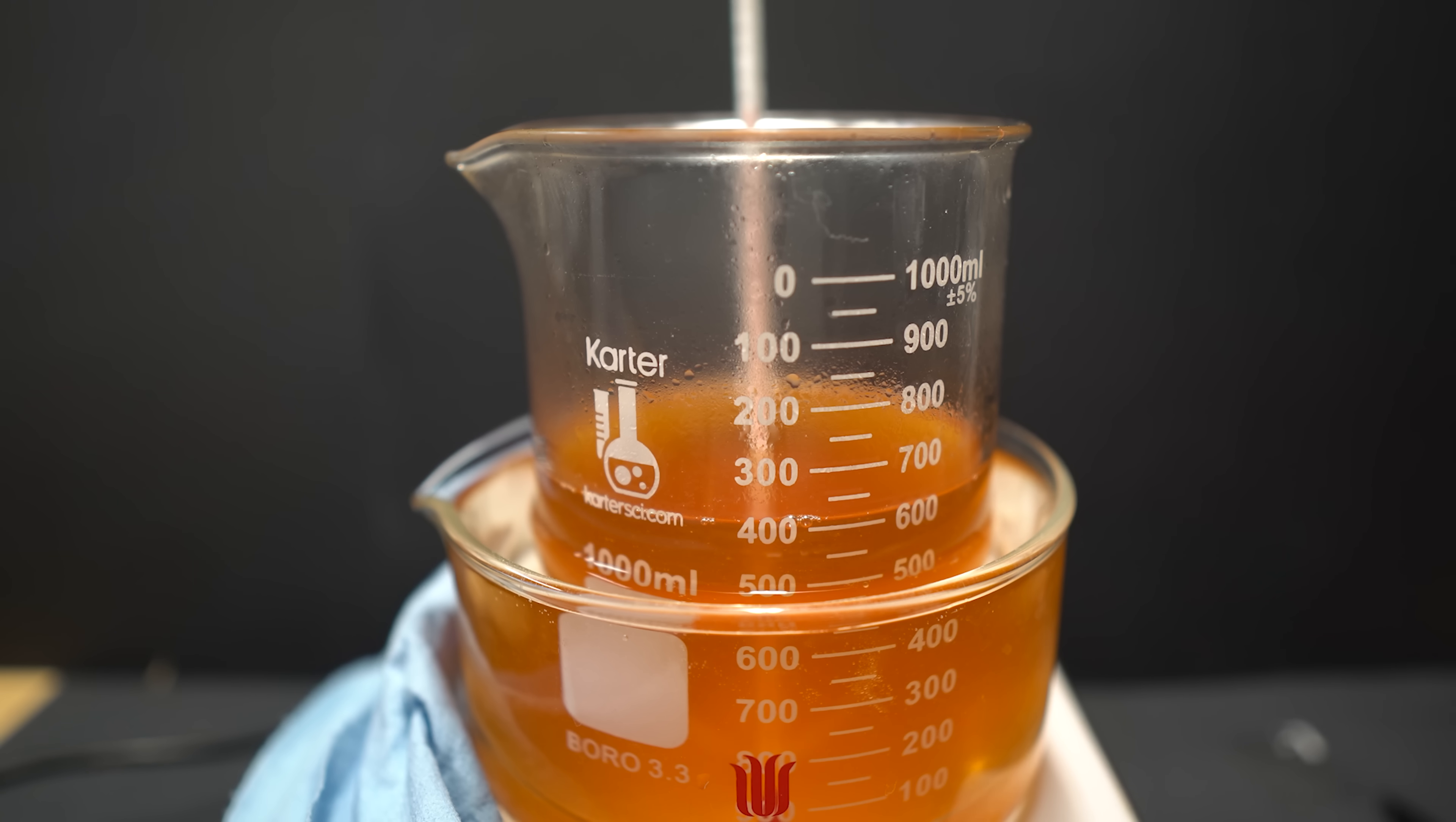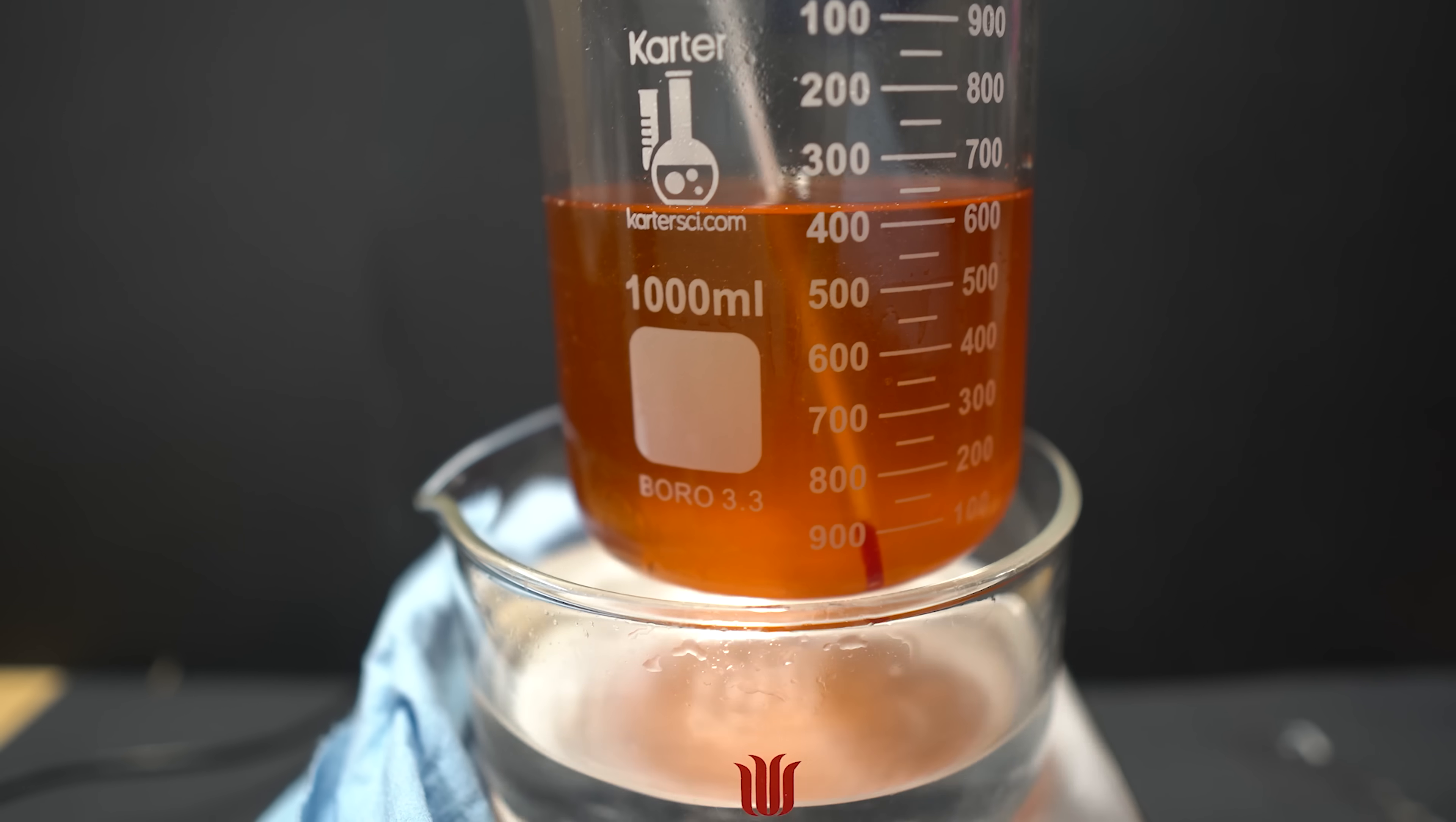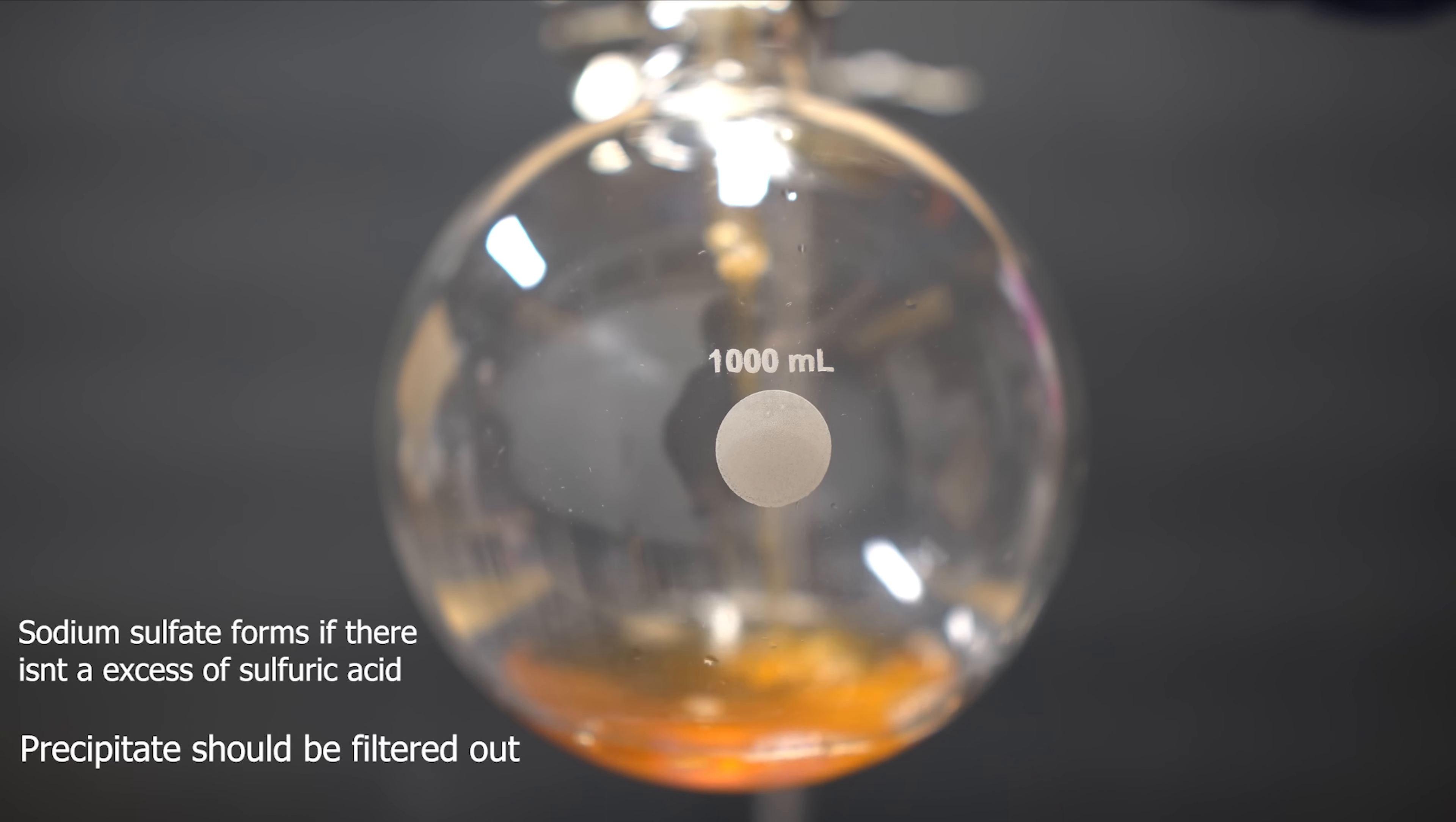Once the addition was done, you should let it cool, and the sodium sulfates and sodium bisulfates will precipitate out. I let mine cool for a while, however, not really much crystallized.